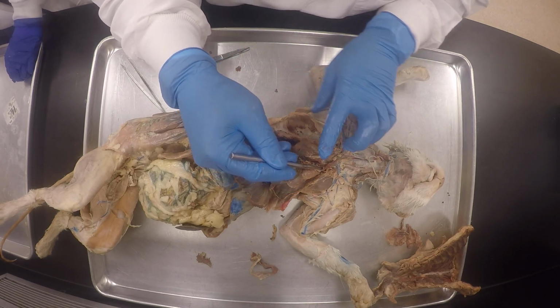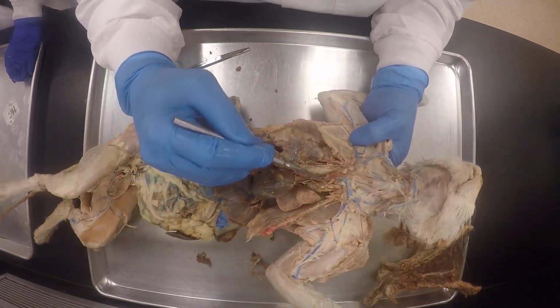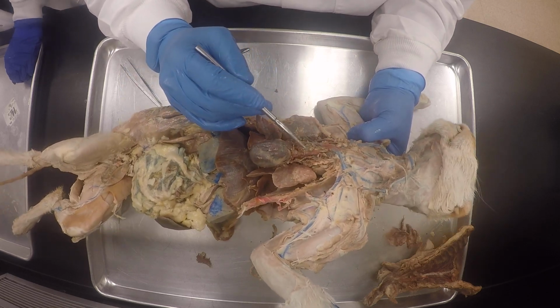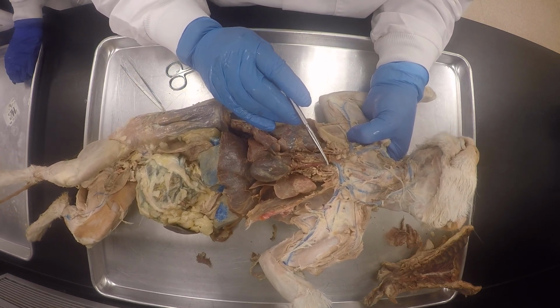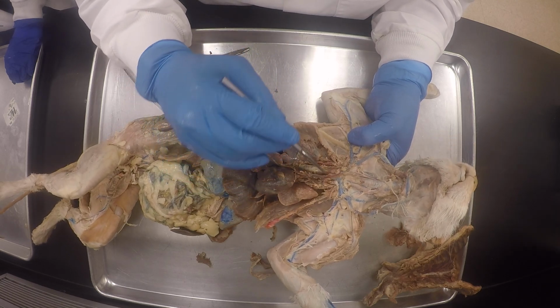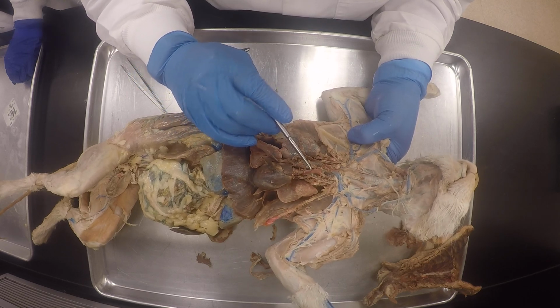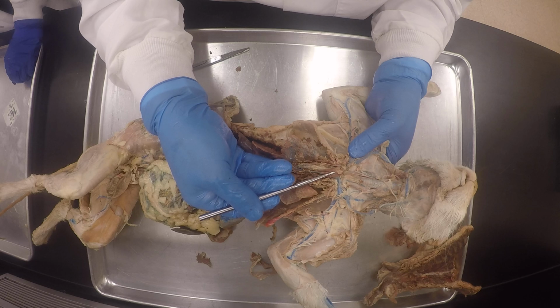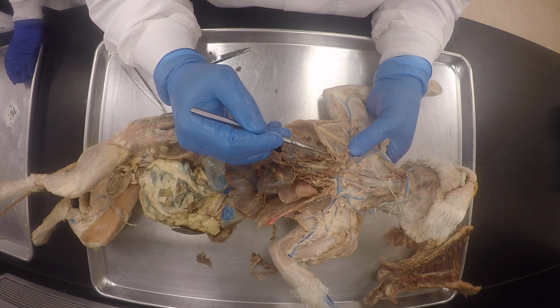You see what I'm saying? Looky here. Do you see it, my good friends? So this is the brachiocephalic trunk. We have to scoot around this. See, brachiocephalic trunk. So there's the right common carotid, right? And then there's the left common carotid here, coming from the brachiocephalic trunk. And then this is the right common carotid. And so this is the subclavian. And there's the other mammary gland, internal mammary.